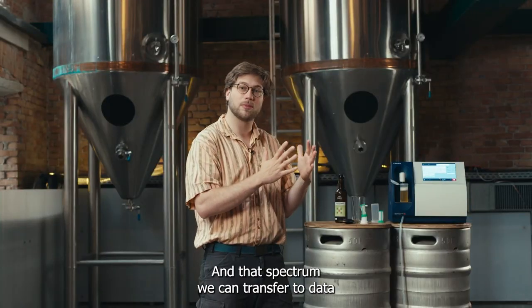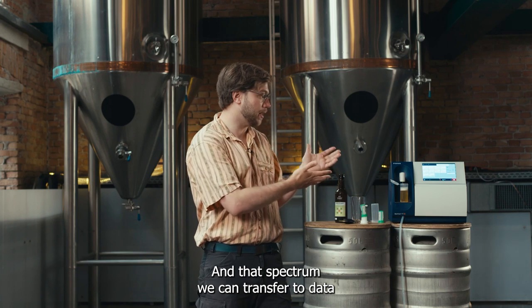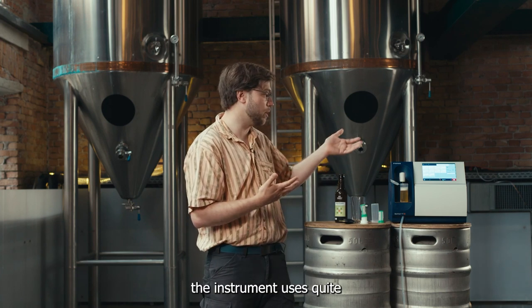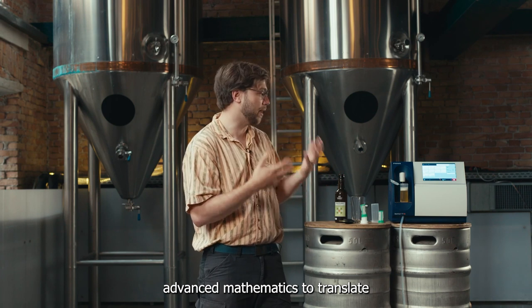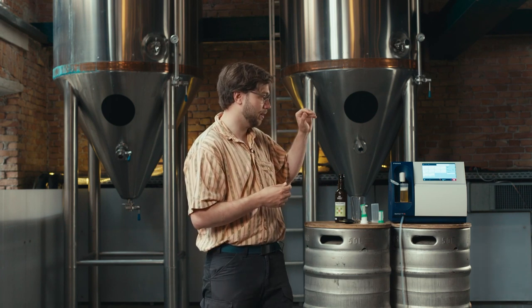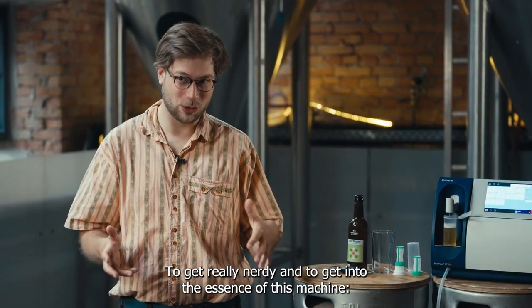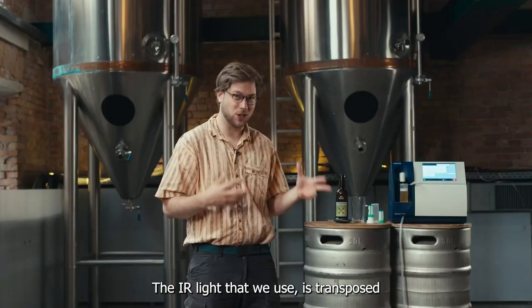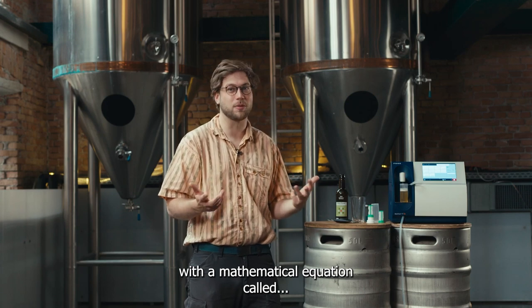In that spectrum we can transpose over to data. The instrument uses quite advanced mathematics to translate the alcohol peak into an actual alcohol value. To get really nerdy and into the essence of this machine: the IR light that we use is transposed with a mathematical equation called Fourier transformation.